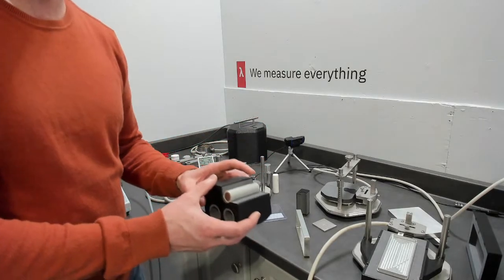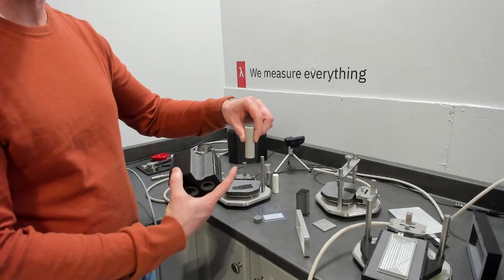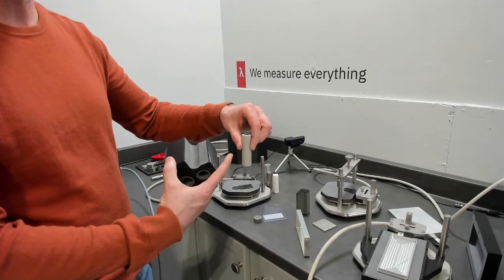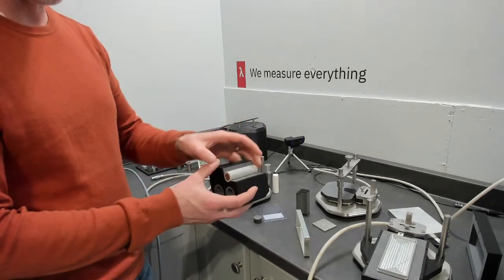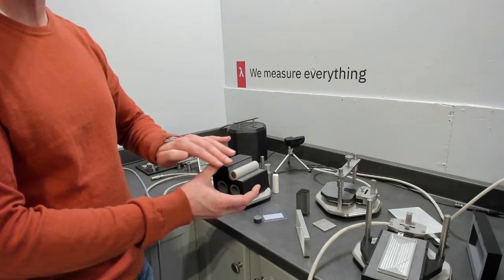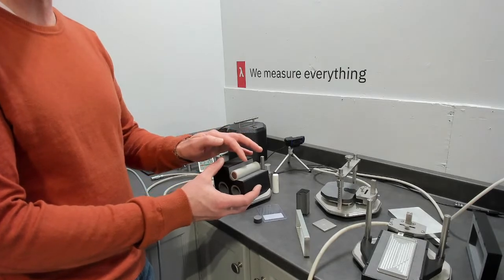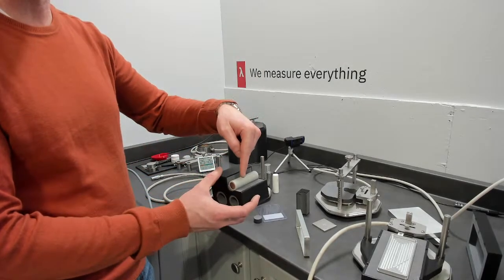There's some small error, but one way of determining it is when you measure along the height of your sample, 1D, and you look at this configuration, your in-plane direction is the same direction as that one-dimensional direction, and now you have the additional direction of into the battery.